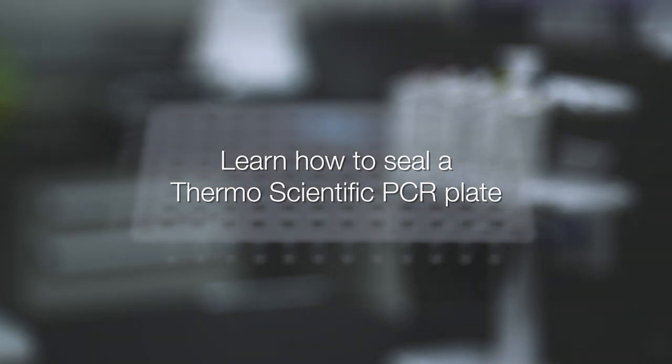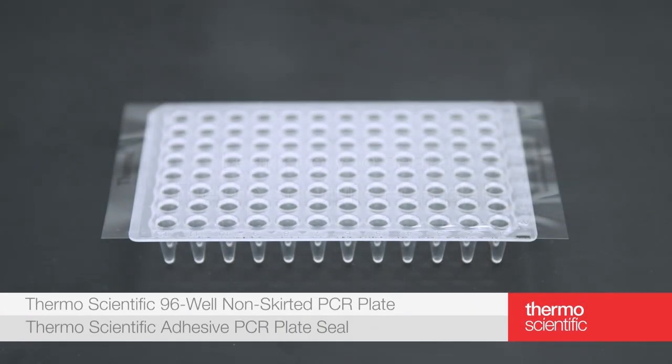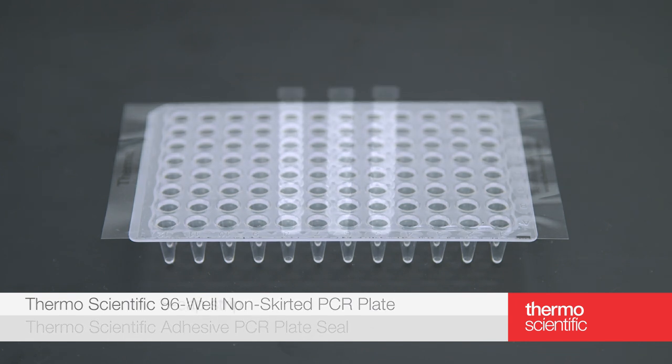In this video, we'll discuss how to properly seal a plate using two methods: use of an adhesive film and cap strips.